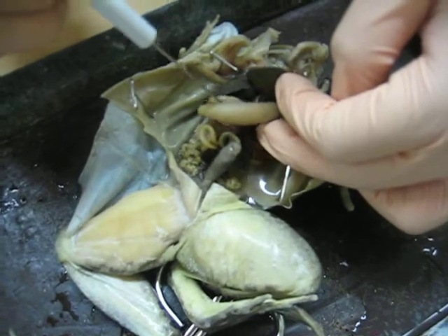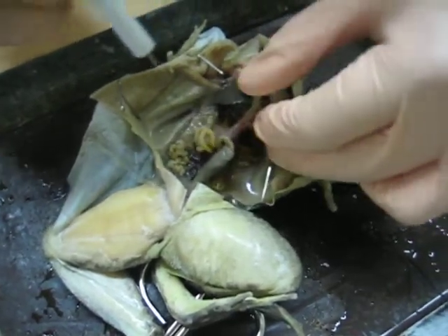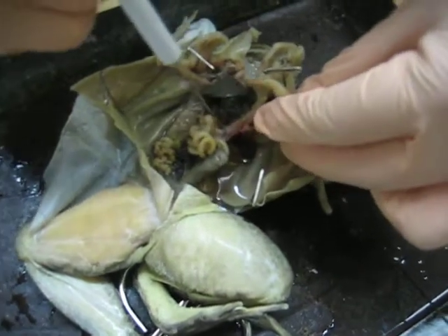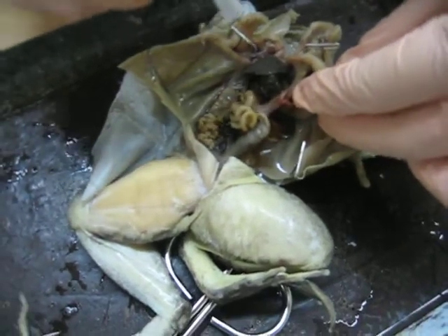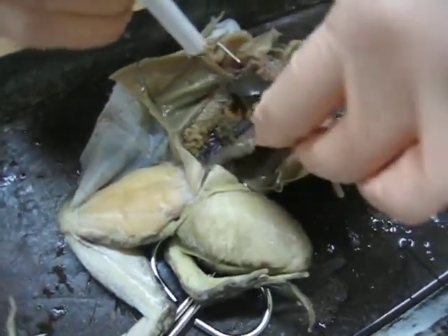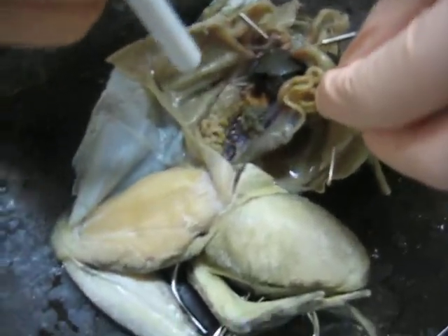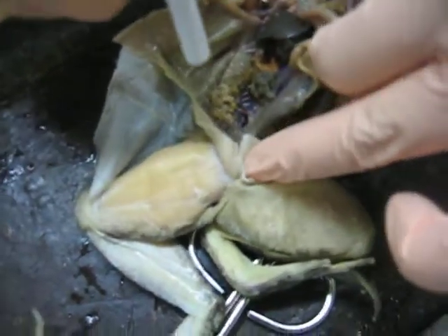Mesentery is the one that's holding all of this together. And then small intestine. Small intestine. Large intestine. Large intestine. Anus is down here.